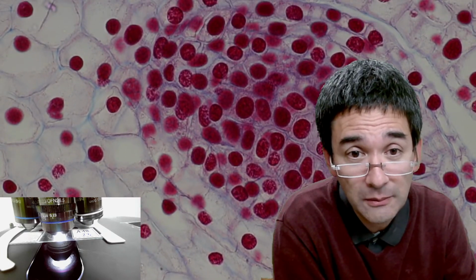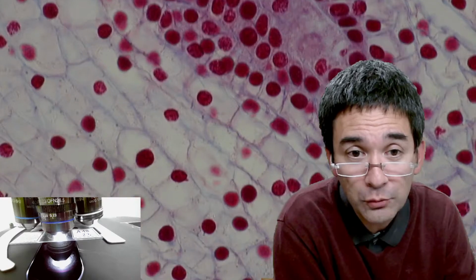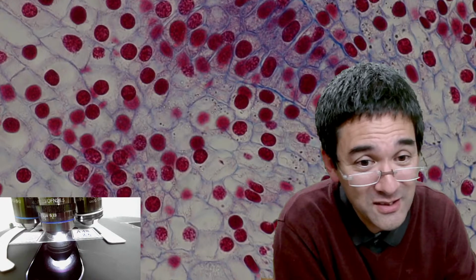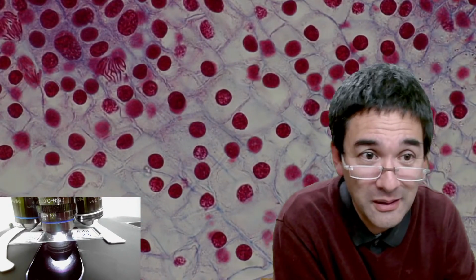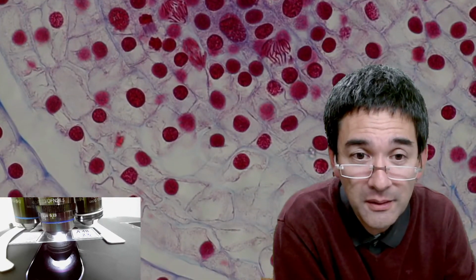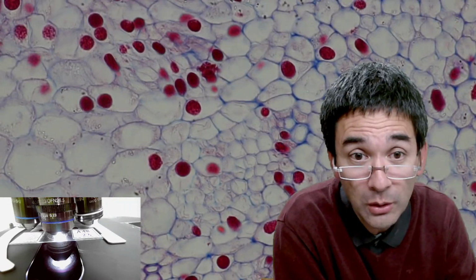I know even if it costs a little bit of money, sometimes those prepared slides are also pretty nice, because sometimes you're able to see things that you're not able to easily prepare at home. Normally, of course, we hobby microscopists take water samples, we see movement, and all these things. Obviously, it's very nice, of ciliates and worms and rotifers and amoeba and so on. But there are also some interesting things that can be seen simply on commercial permanent slides, because sometimes we don't have access to all of those specimens.